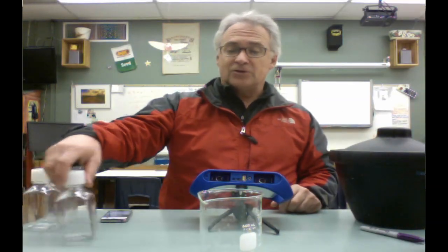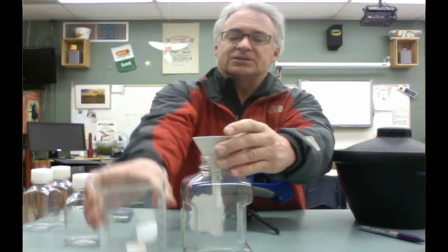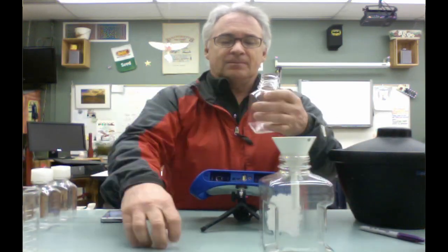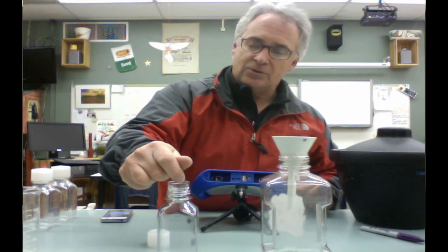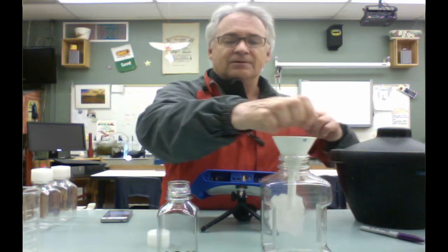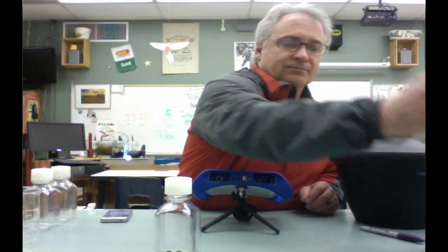So to get things started, we're going to first of all start with the dry seeds. These are just regular pea seeds. There's about 25 of them in. You only need 10 really, but you're going to put in 10 of them. What I'm going to do is use this bottle here with a funnel and just pour the dry seeds in there. I'm going to count out 10. Put that off the side. And they don't get any water or anything. 1, 2, 3, 4, 5, 6, 7, 8, 9, 10. And I'm going to set that off to the side. Put these back in.